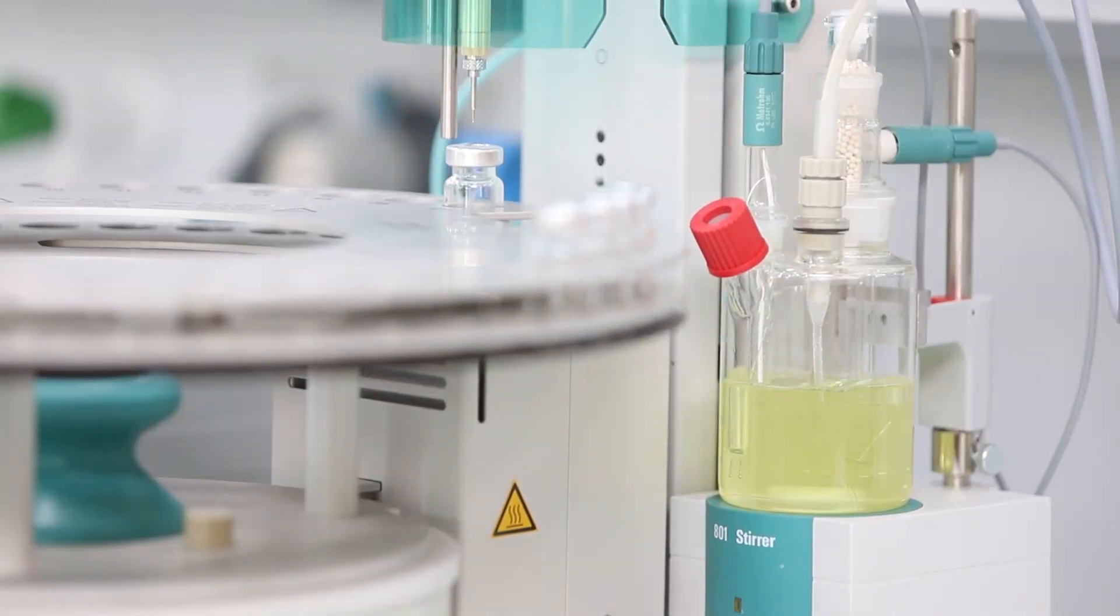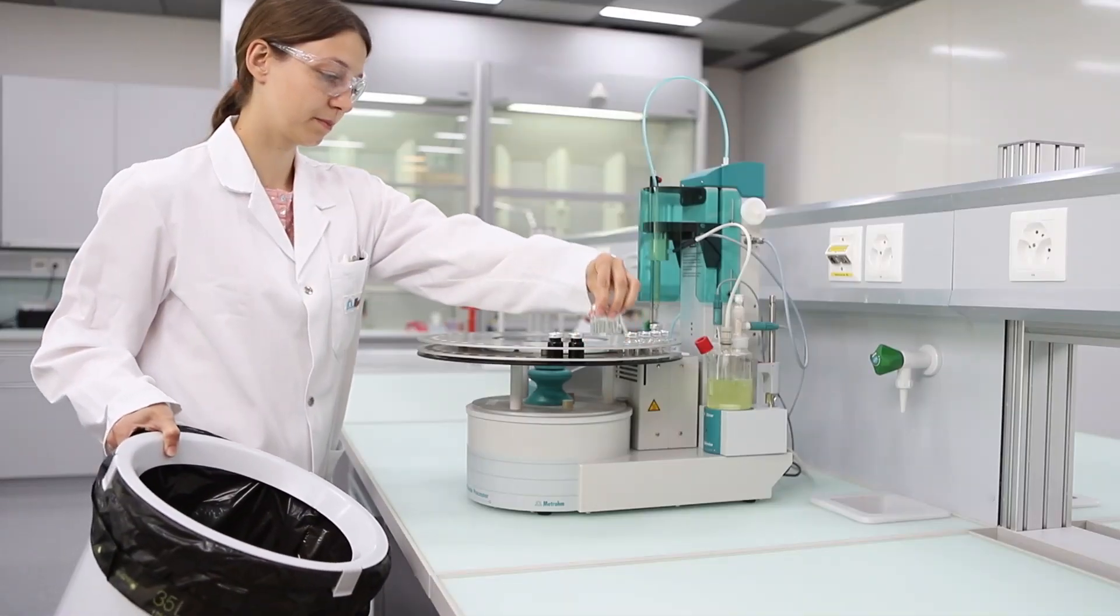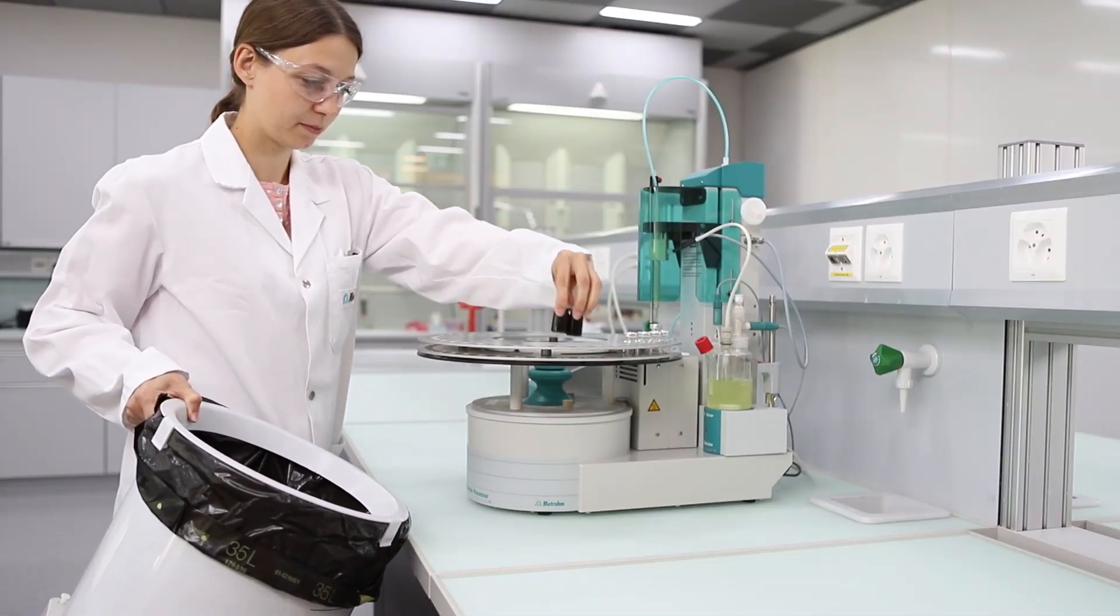The oil and any components that might negatively affect the determination stay behind in the single-use vial. This can be disposed of after the determination is finished.